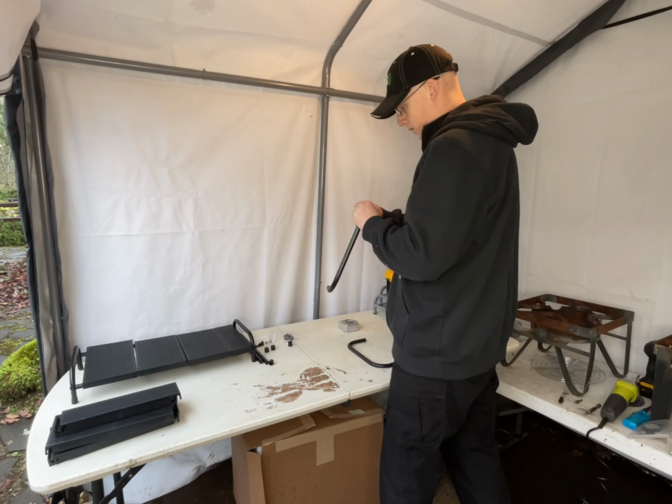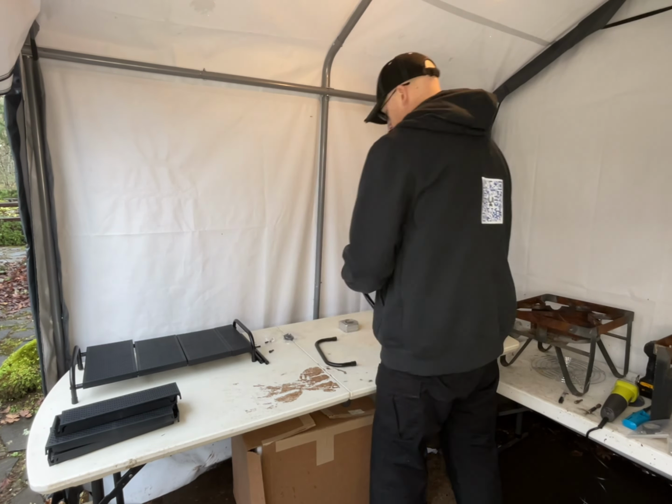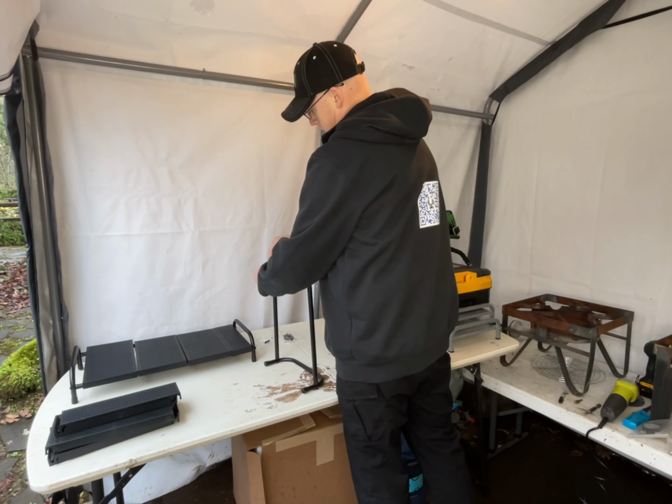They do telescope out quite a ways. Now, make sure you're wearing safety glasses. I did not, and I wished I had in this case. Didn't do anything bad, but I would have liked to have had them.